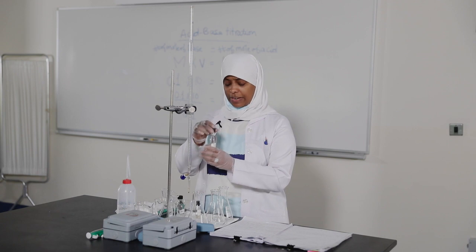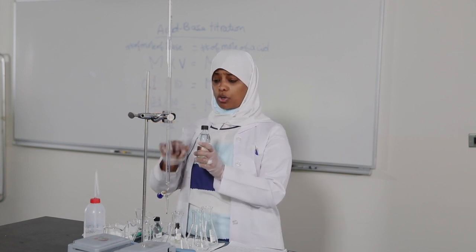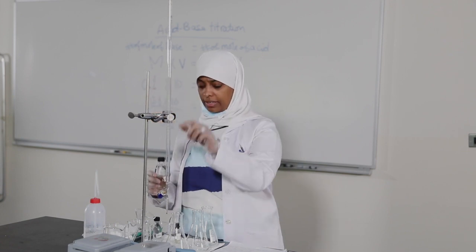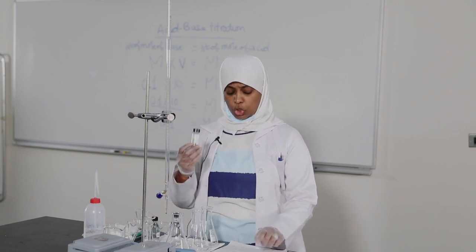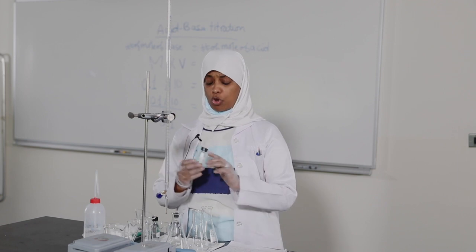The substance placed inside the burette is called the titrant. Today, the substance we will place inside the burette is NaOH. Our titration will be between NaOH and HCl, with a helper called an indicator — which is phenolphthalein. The indicator is a weak organic acid or base.